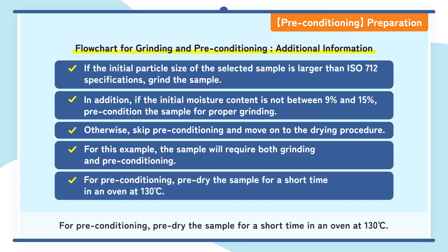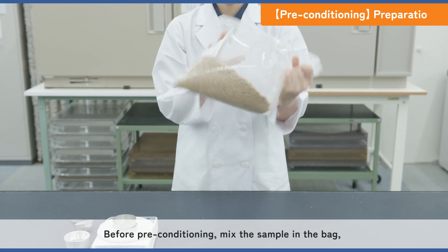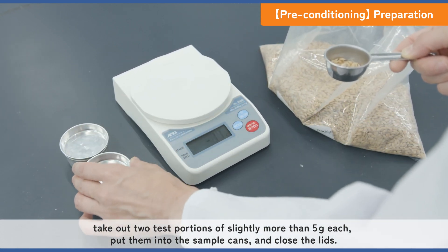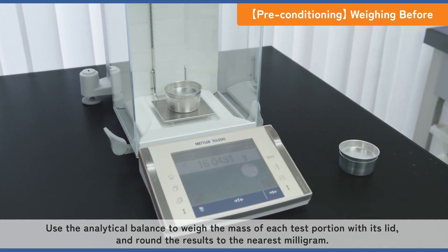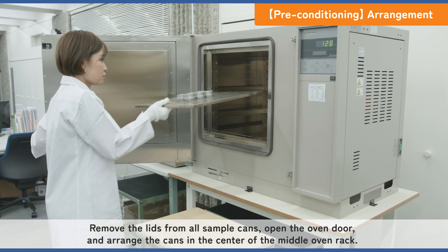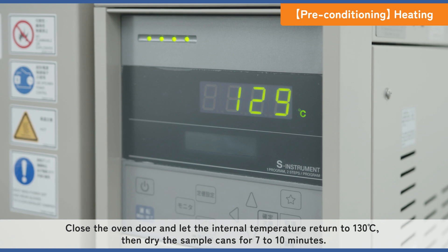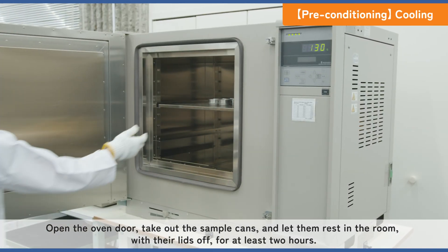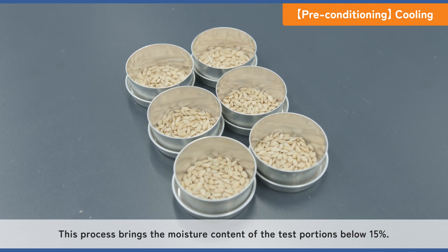For preconditioning, pre-dry the sample for a short time in an oven at 130 degrees Celsius. Before preconditioning, mix the sample in the bag. Take out two test portions of slightly more than 5 grams each. Put them into the sample cans and close the lids. Use the analytical balance to weigh the mass of each test portion with its lid and round the results to the nearest milligram. Remove the lids from all sample cans, open the oven door, and arrange the cans in the center of the middle oven rack. Place the lids under or near the cans in the oven. Close the oven door and let the internal temperature return to 130 degrees Celsius, then dry the sample cans for 7 to 10 minutes. Open the oven door, take out the sample cans, and let them rest in the room with their lids off for at least 2 hours. This process brings the moisture content of the test portions below 15%.